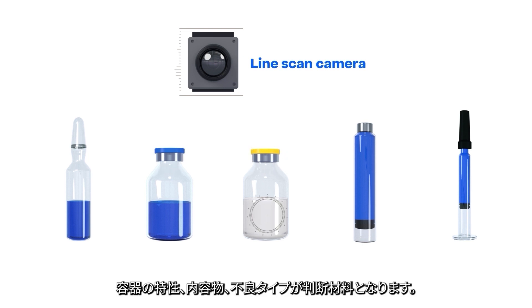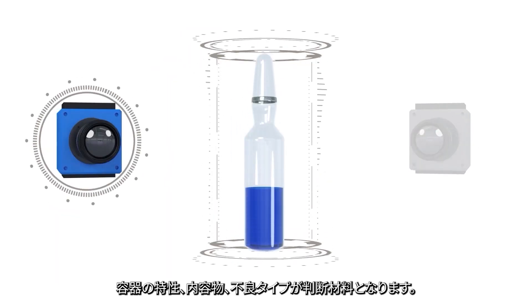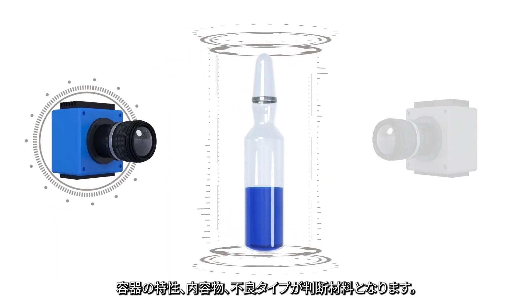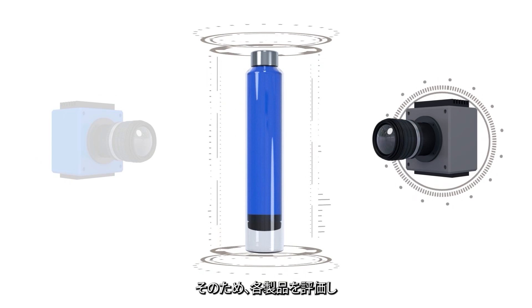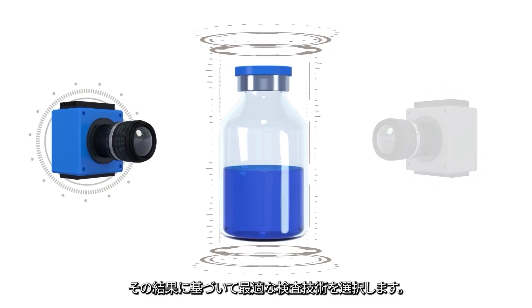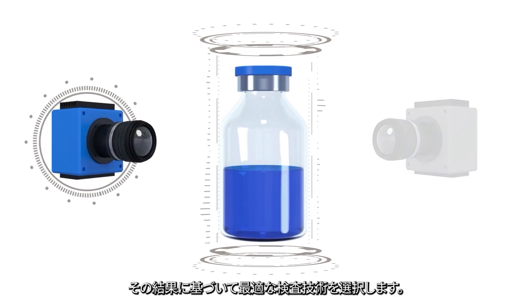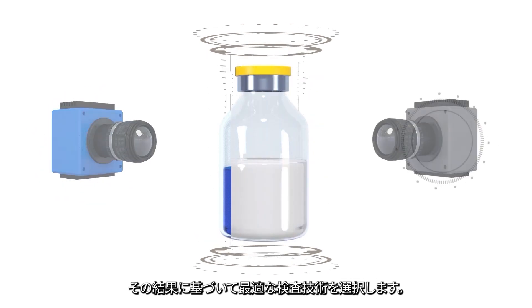The characteristics of the container, its contents and defects are decisive. Therefore, we evaluate each product and select the most appropriate inspection technology based on the results.